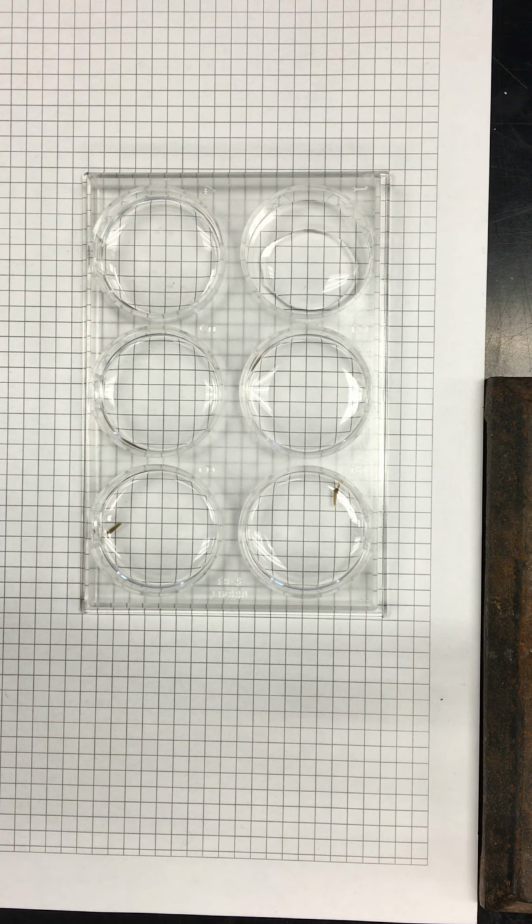You guys have what again? Serotonin. Yes. So let's say that you determine that, and what's your highest concentration of serotonin that you're going with? This one. I think we might have to adjust. Your highest one is the 100. Yes, 2 milliliters water. So that's straight, that's just going with straight undiluted stuff from here. I'll actually need to make more for you. Otherwise, it's going to be too concentrated.